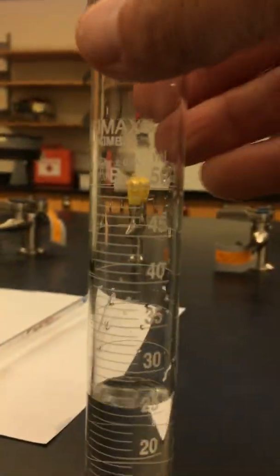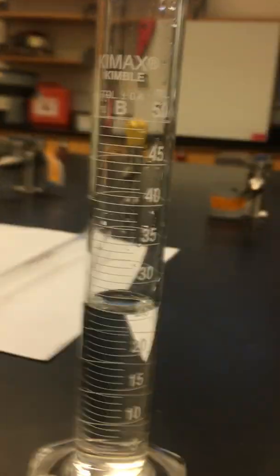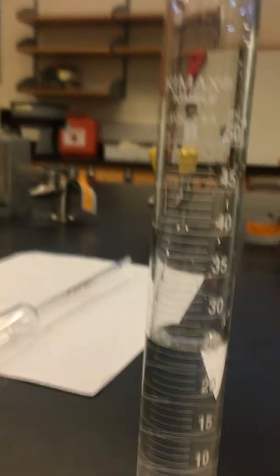We will be taking a picture and sending you the volume in the graduated cylinder so you are able to measure it. Thank you.